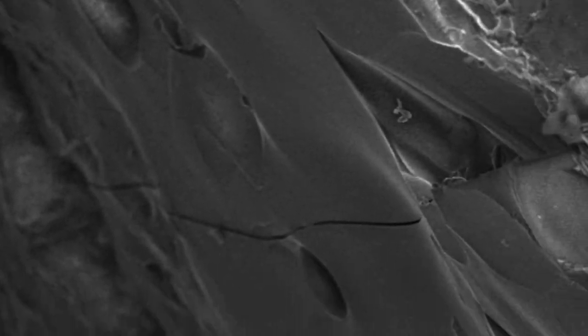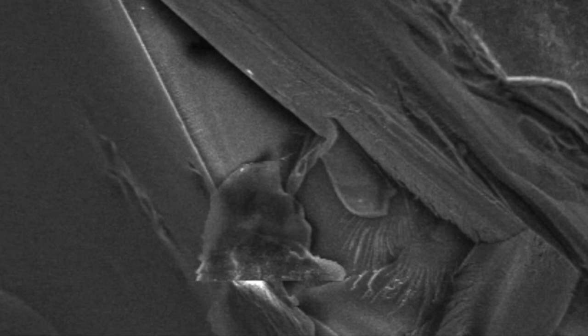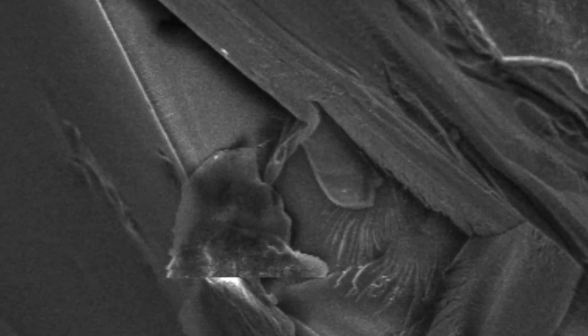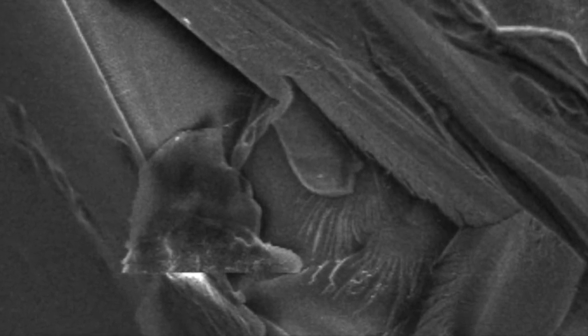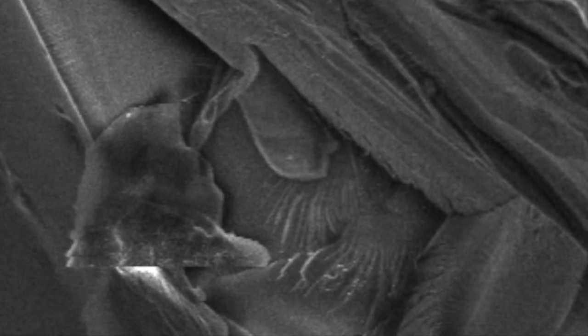And then on the bottom section, we can see these iron molecules as they were coalescing inside of that glaze bubble. So this is like an oil spot droplet forming in the middle of the glaze, just frozen in time.